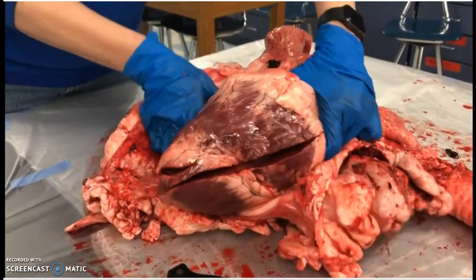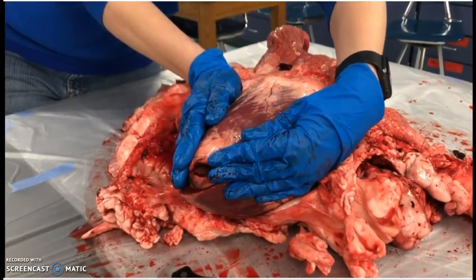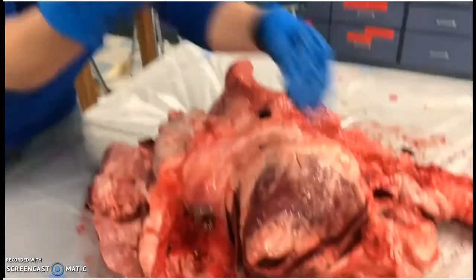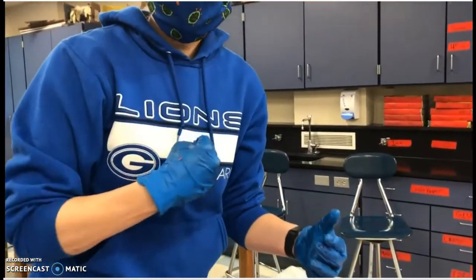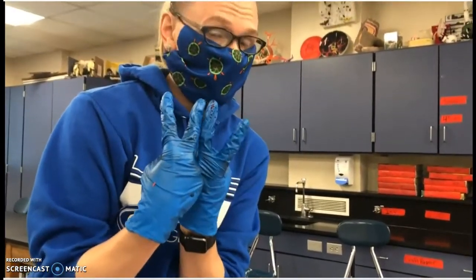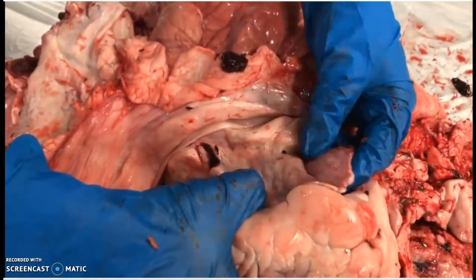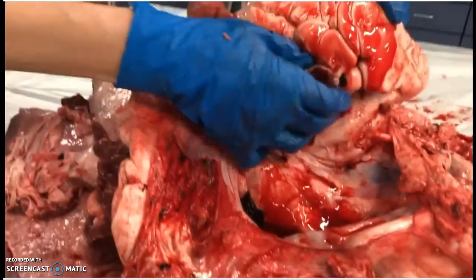On the outside of the heart — the exterior — remember these are the ventricles. Ventricles make a V. If my heart's upright in my chest, ventricles make a V. Human hearts are about the size of your fist, about in the center of your chest. Ventricles are on the bottom, there are two of them inside the heart. Your two atrial chambers are on the top and they look like little flaps — one here and the other tucked way underneath.